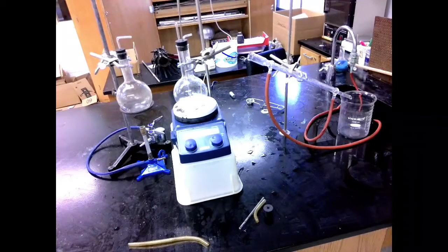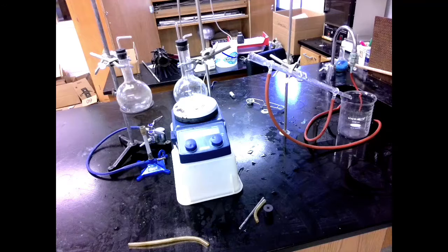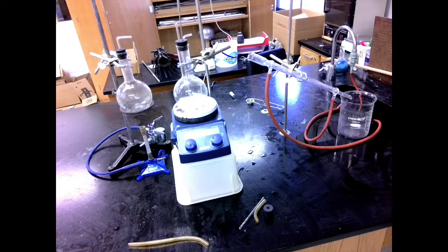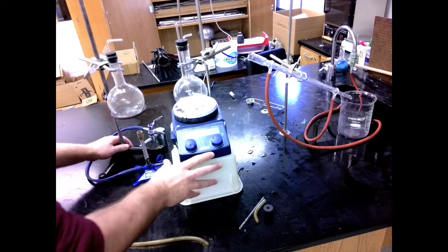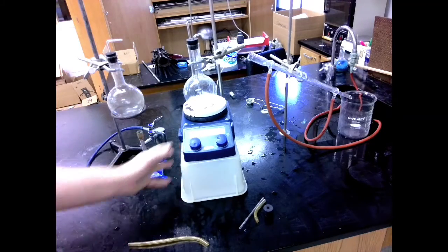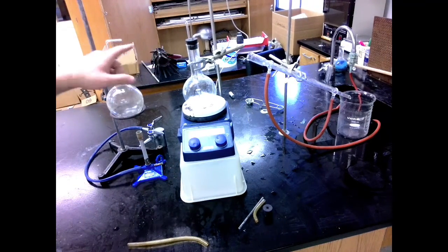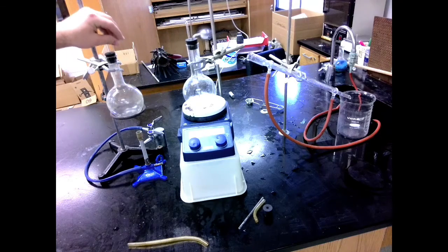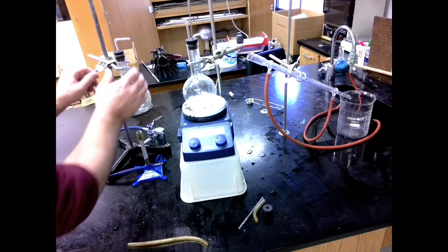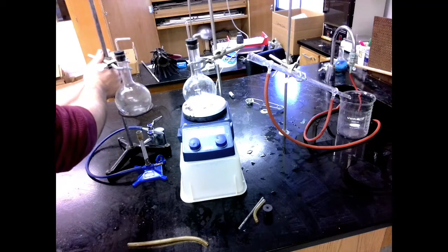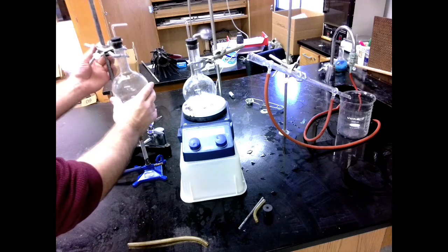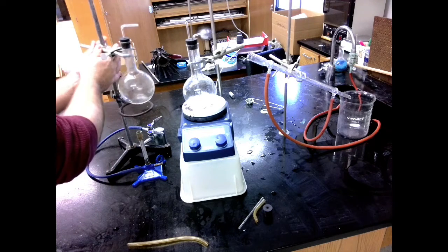Now here I have all three parts individually set up and ready to go. But now I need to line them all up with each other. The easiest one to move around is actually going to be this middle part. So I'm going to kind of meet this one to the other two. Right now I can see my heights between these two are kind of off. I don't like that. I want these heights to be very similar. So I'm actually going to be adjusting this to go up a little higher.